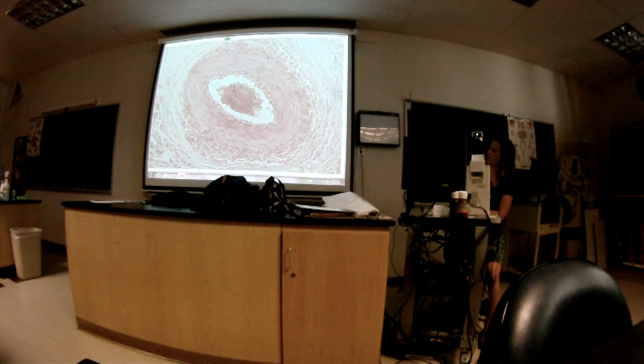What's the name of that main layer? Okay, question 7 is, what kind of tissue is this?